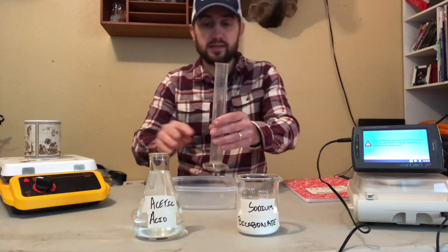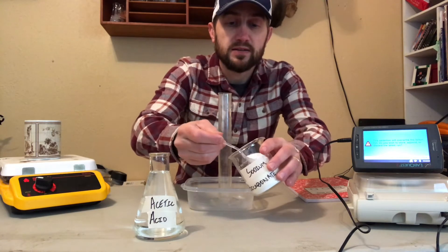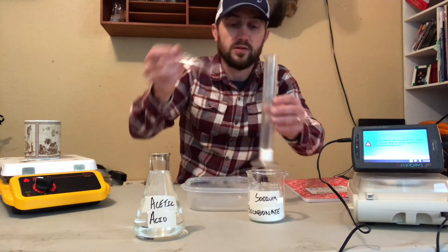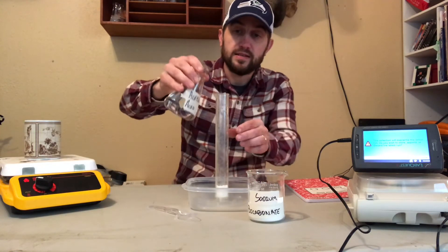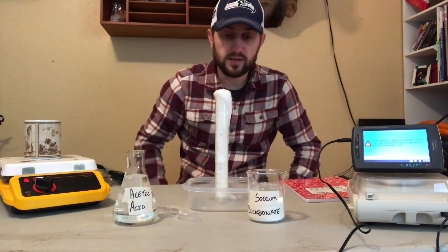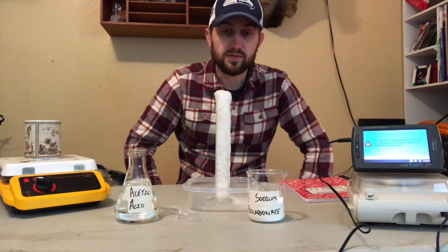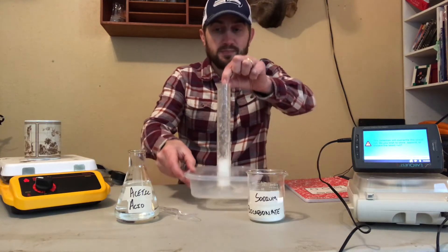Let me grab a little graduated cylinder here. If I were to put some of this sodium bicarbonate into the graduated cylinder like so, then take some of your acetic acid and pour it in like so — you get this bubbling and fizzing. Probably a little more of the reaction can still happen, it goes up over the top and you get yourself a little bit of a mess.